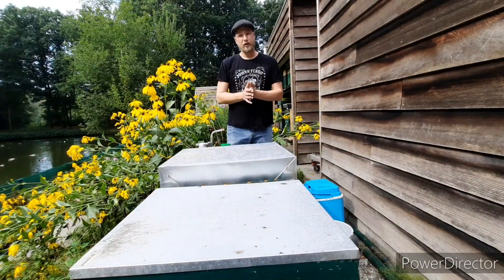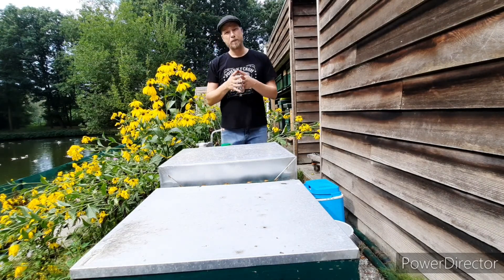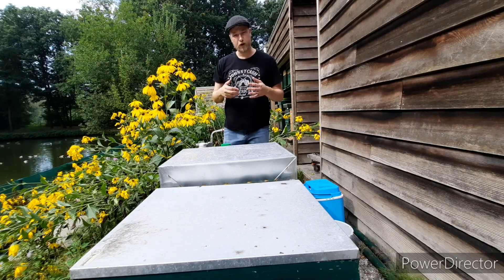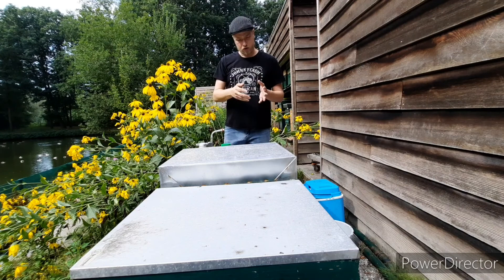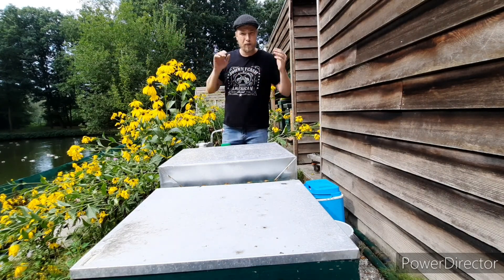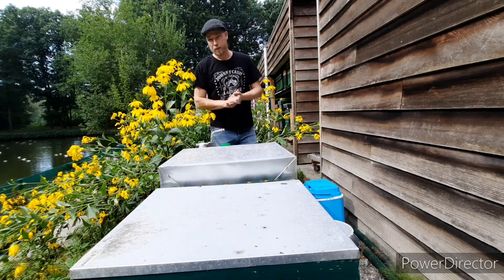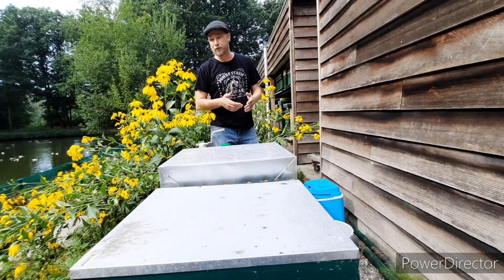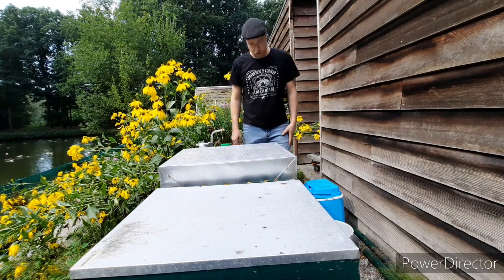Those 300 bees die now, but it's for the greater good. In the following years those 300 bees can be part of the saving of maybe millions of bees. So it's for the greater good. Sorry about the noise — they're working out here, and well, people who work gotta work.